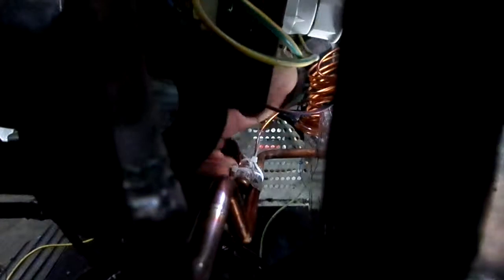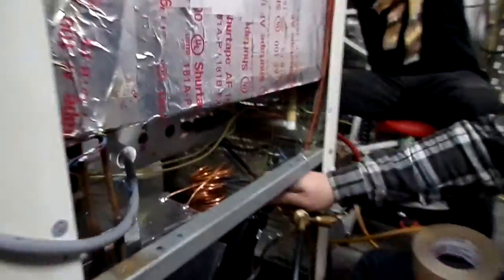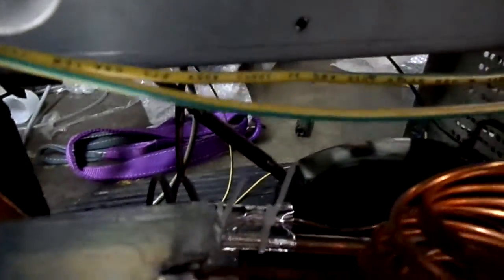So we tape those. Grab a couple. That is the last two. Grab a couple of zip ties. Zip those guys under. 2 zip ties per bulb. It's not absolutely necessary. That's just how Leica does it and, you know, I figured they do it for a reason, right? So you zip them on there, and then you'll also do the same sort of thing with the temperature sensors that you've removed from the system.